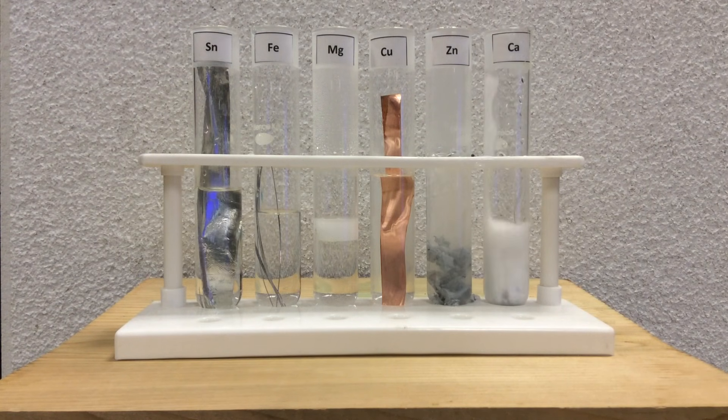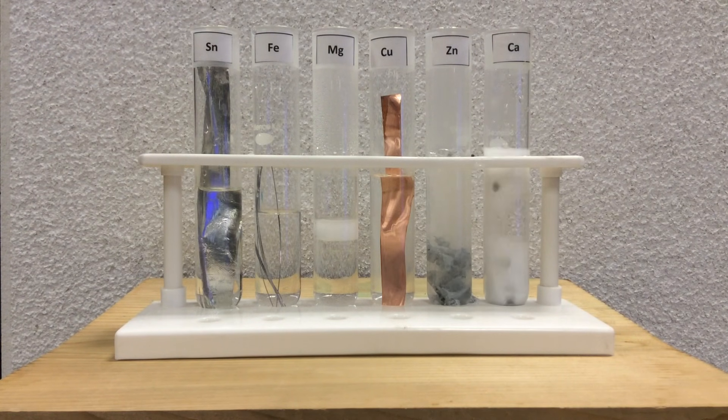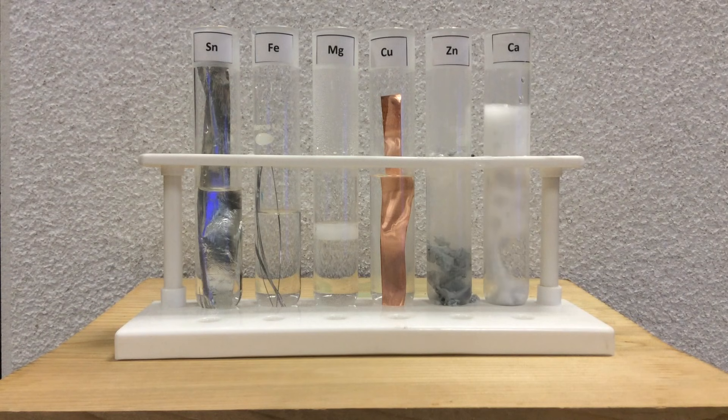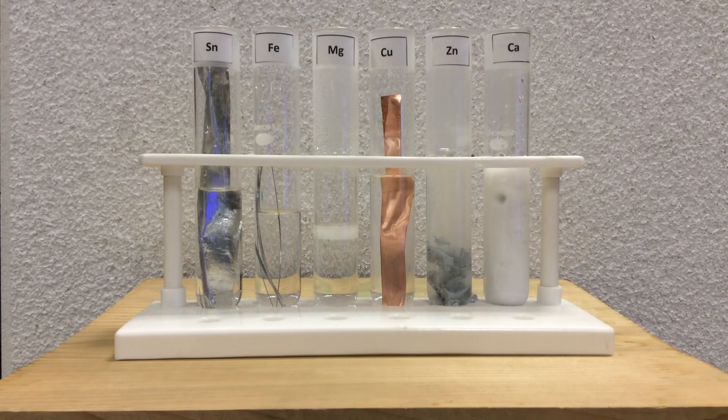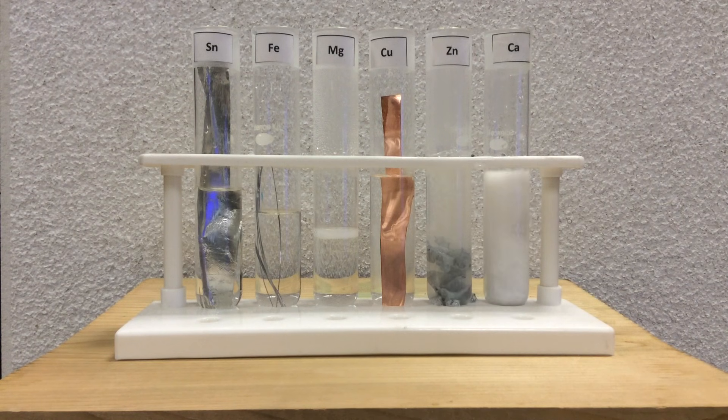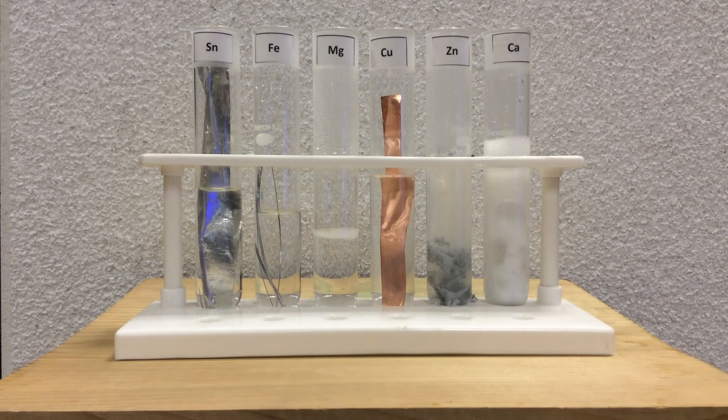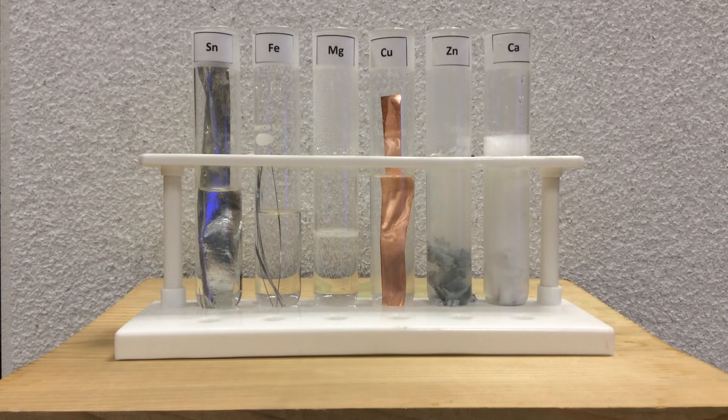In any case, we can see that the magnesium seems like it's done. It's reached completion. The magnesium was so reactive the metal that I had in there has completely turned into magnesium plus two aqueous ions. So you don't see a reaction anymore. So don't think the magnesium is not as reactive as the zinc. The magnesium has reached completion.